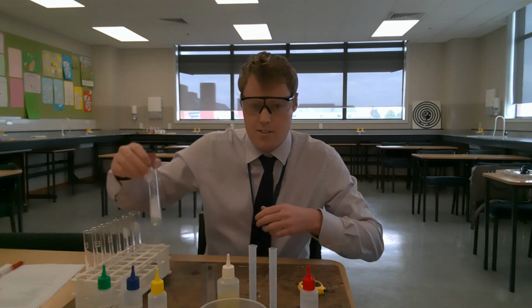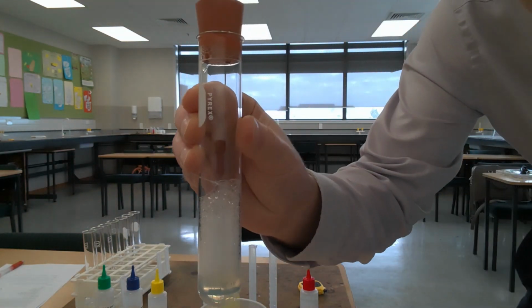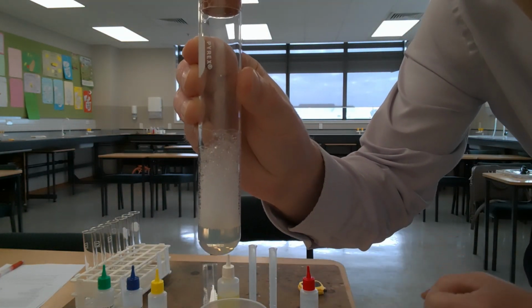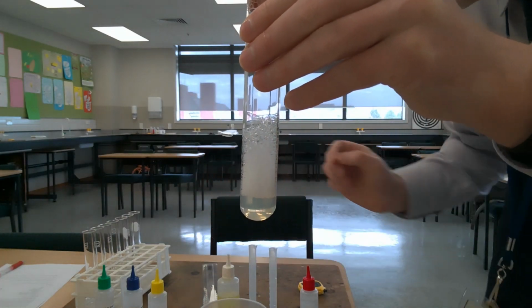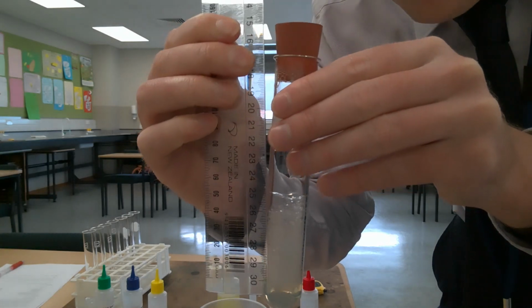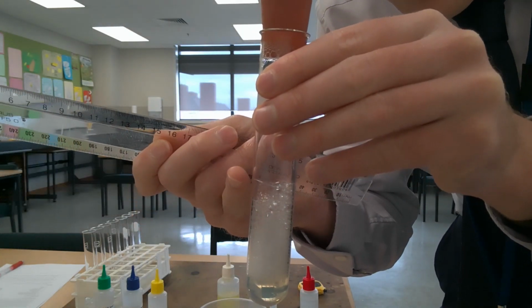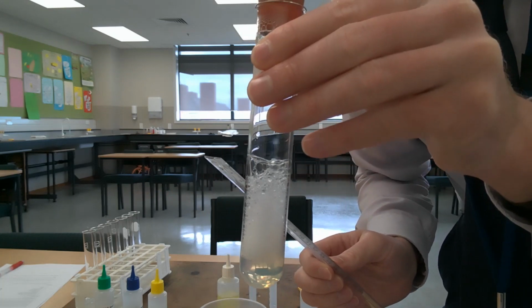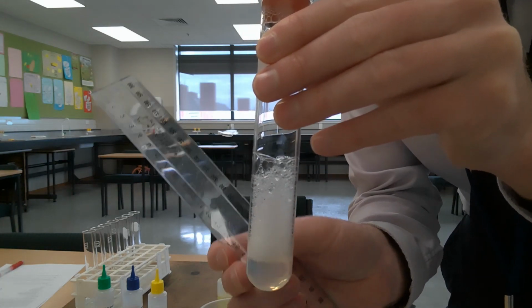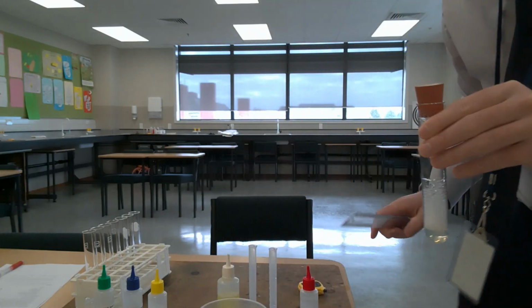I just want to bring this closer to the screen so you can see what we're actually doing there. You can see hopefully on there we have a liquid component at the bottom, and then we have a lather component. What I did was take the ruler, and I will try and do this for the camera, and place it so that we can measure the height from the bottom of the lather to the top of the lather. So just to give you a clearer sense of what we are measuring. So not the liquid part down here, just the lathery part, the bubbly part at the top here.